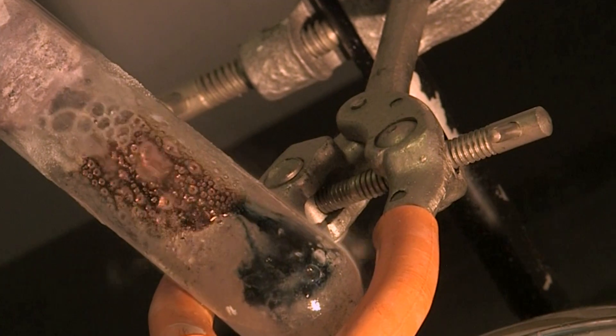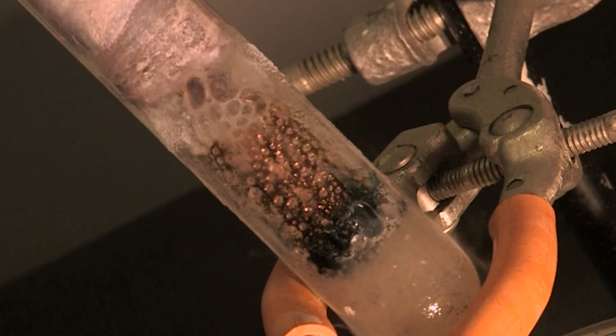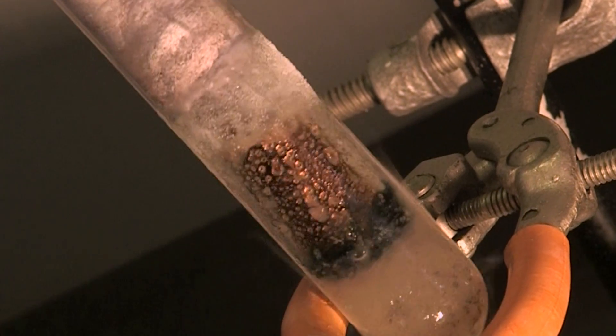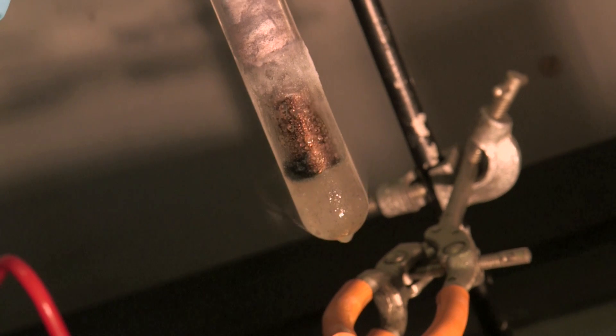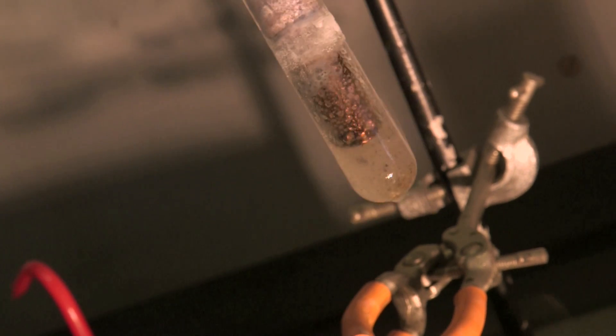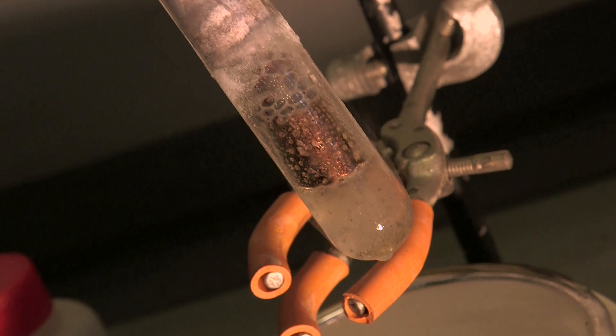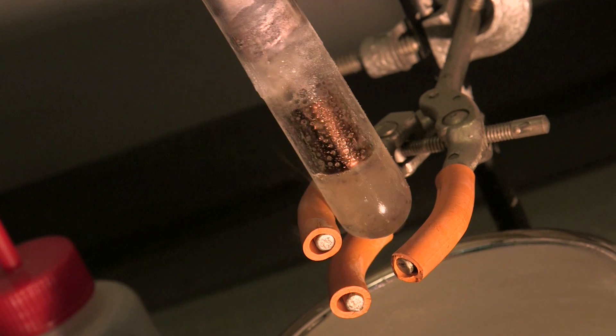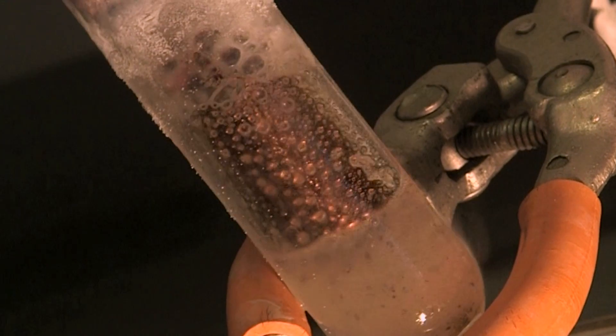So what's the blue and the coppery? What's happening? It's different concentrations of electrons in solution. That's the only difference. Look at that. That's the separation we were looking for. That's right. So the goldy colored bit has more electrons and the blue less. And you can see on the bottom it's just going clear where the isopropanol's reacted. Isn't that funny? The quenching of it actually is more interesting than the... Often the case.